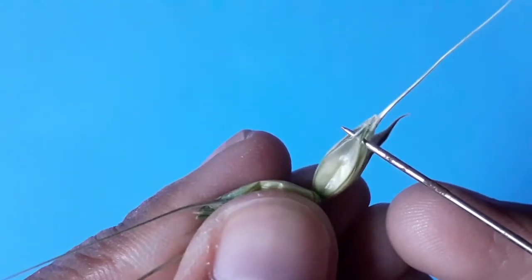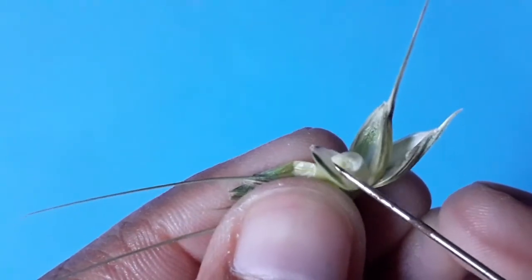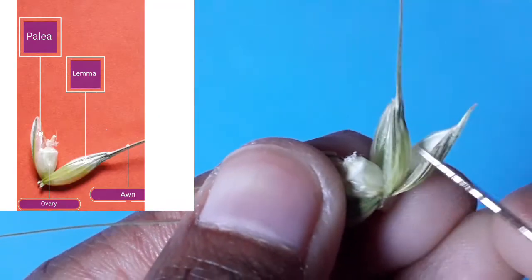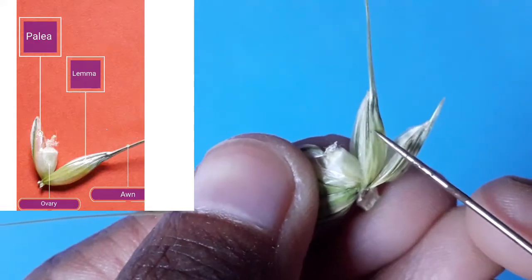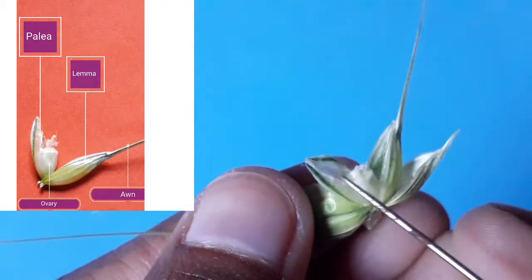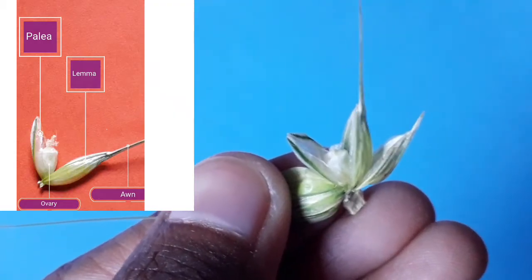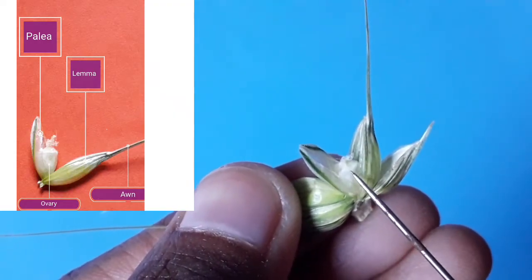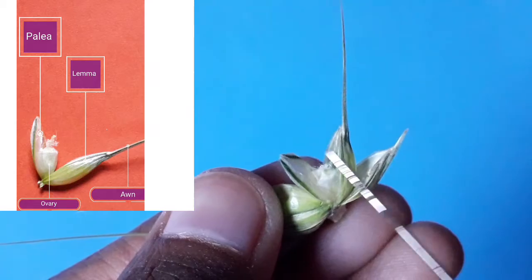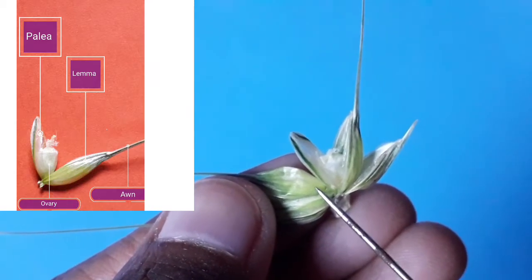Using a needle, you can remove and separate out these structures. This structure you are watching here is the lemma, which has a pointed structure called the awn. This structure here is the palea. In between the lemma and palea there is the ovary, which is developing here and has a feathery stigma. This is one floret; similarly, if you open the other florets you will find the same structures.